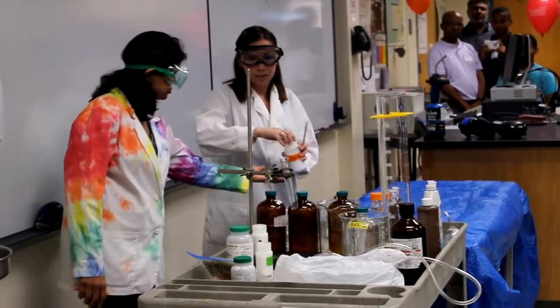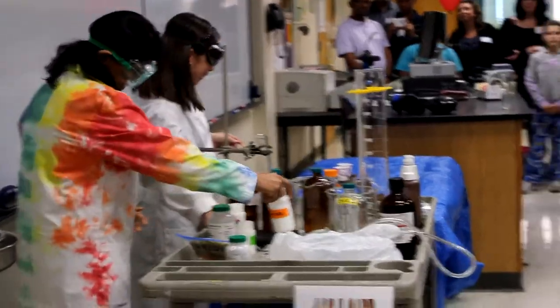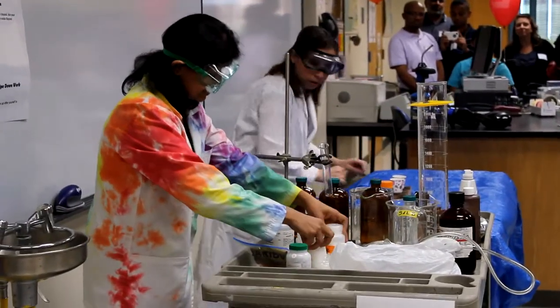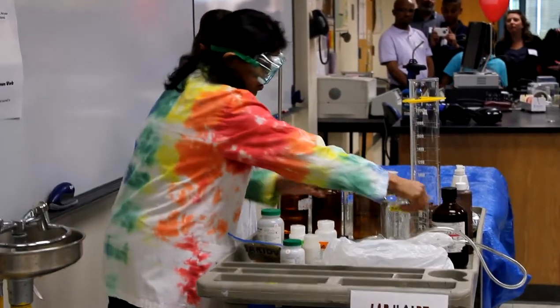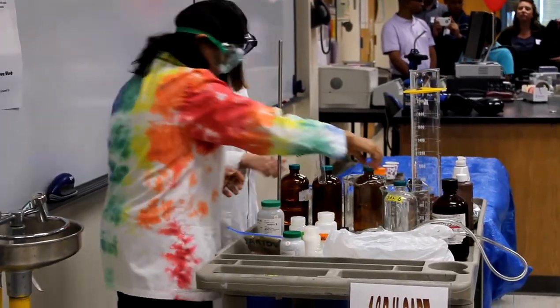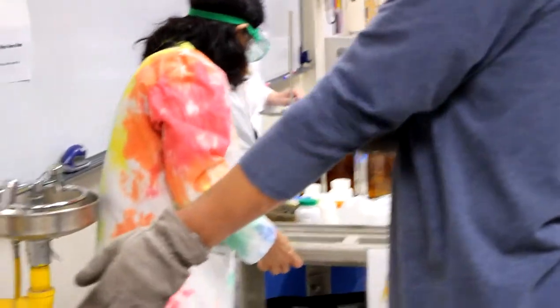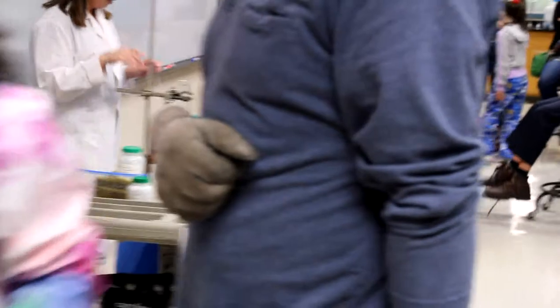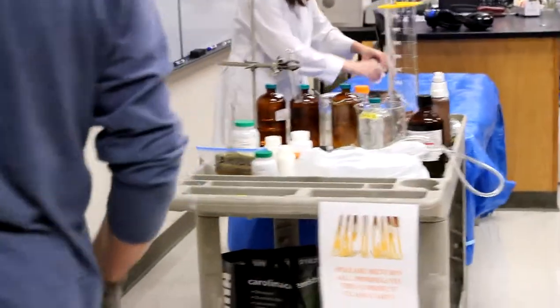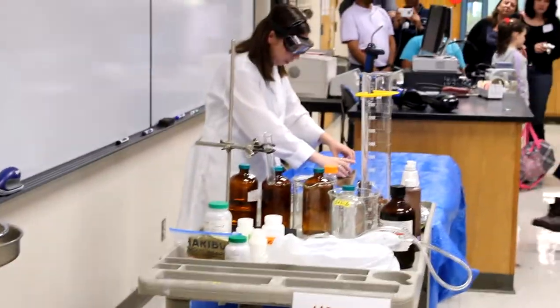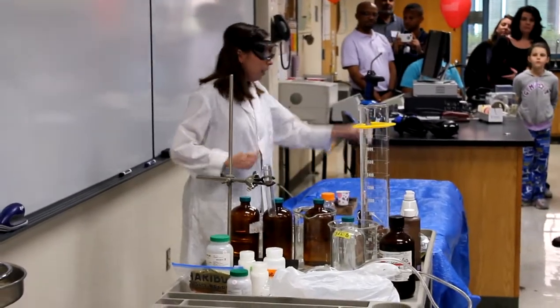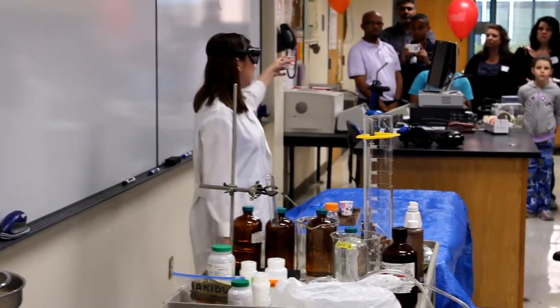You don't want to be near it. So we have our permanganate and glycerol. We're going to get our acid. See, right now as it mixes with the sugar, it's not doing anything.